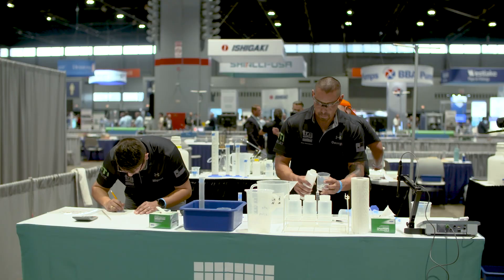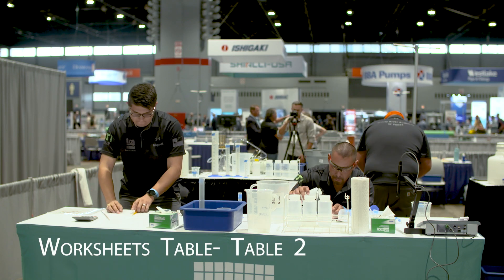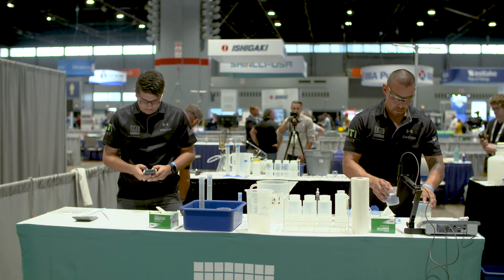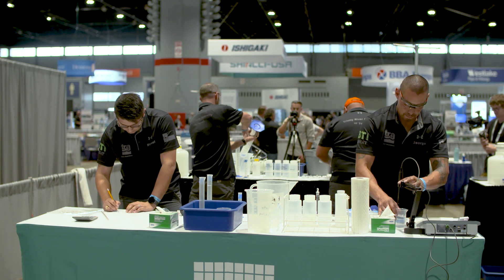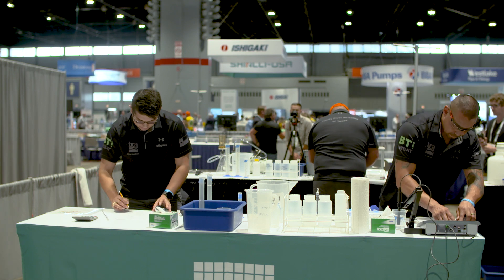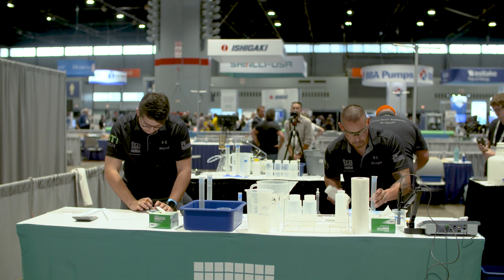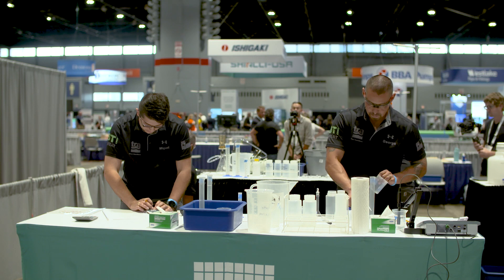Moving to the back table — we'll refer to this as table two for this tutorial. Working on the worksheets and getting the conductivity meter calibrated. Make sure your shakes are proper, that you invert and pour properly. With your samples, when you are inverting them to mix, pour immediately into the graduated cylinder. Don't invert and sit on the table.